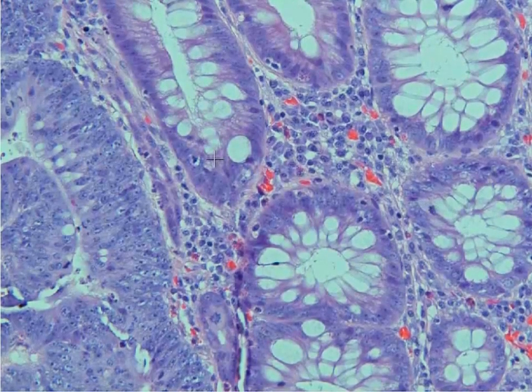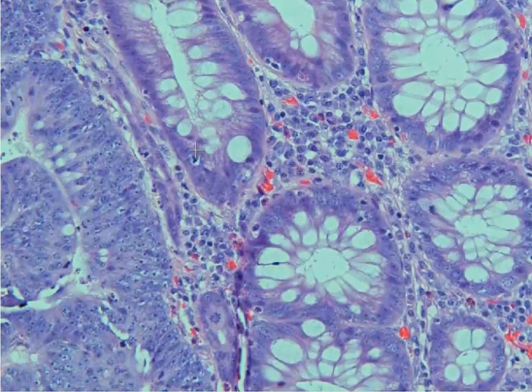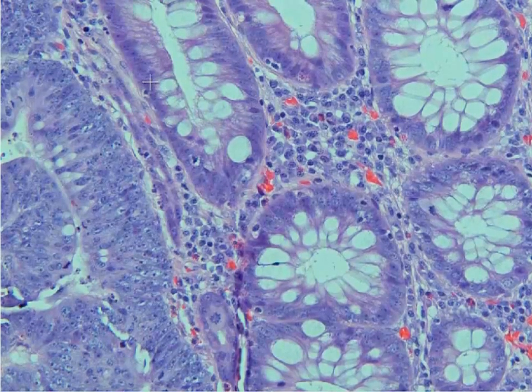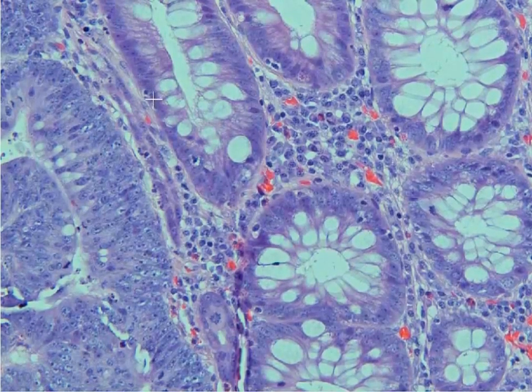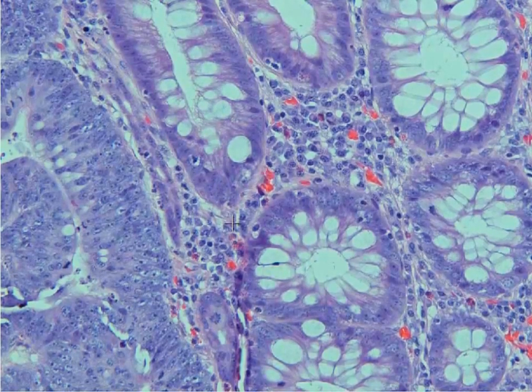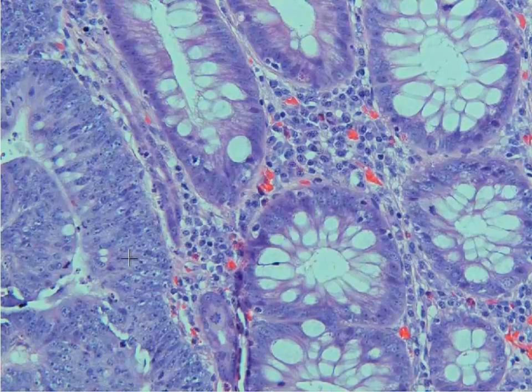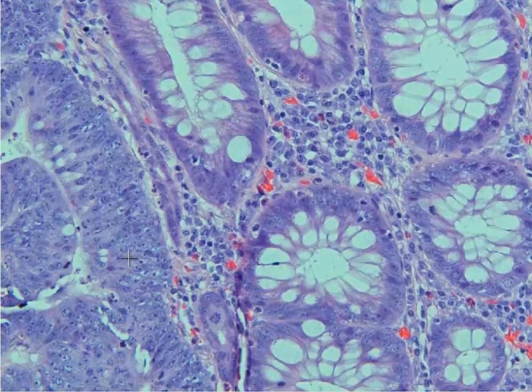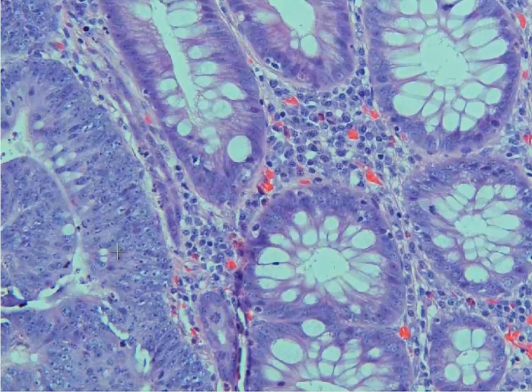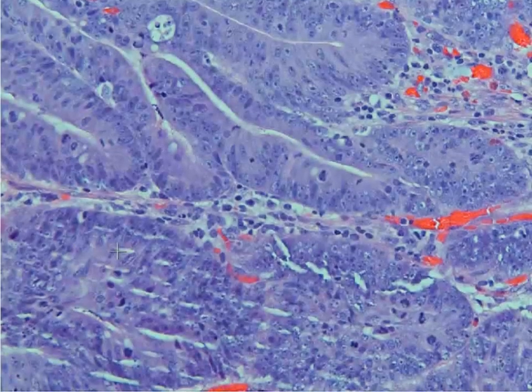At higher power you can see that the nuclei are much different than those next door in the normal colon. In normal colon you have mucinous epithelium with large goblet-like cells and basally oriented nuclei — very small pinpoint nuclei, those little purple dots. In the tumor, the nuclei are enlarged and much larger and easier to identify.